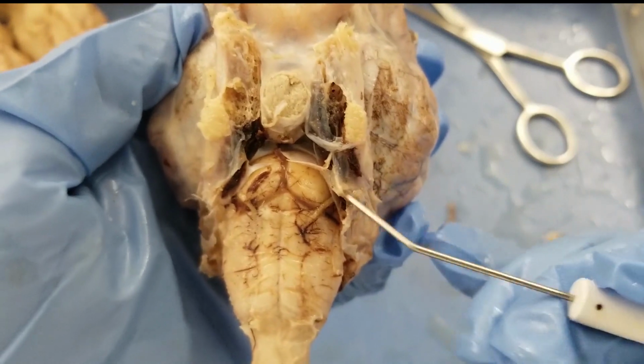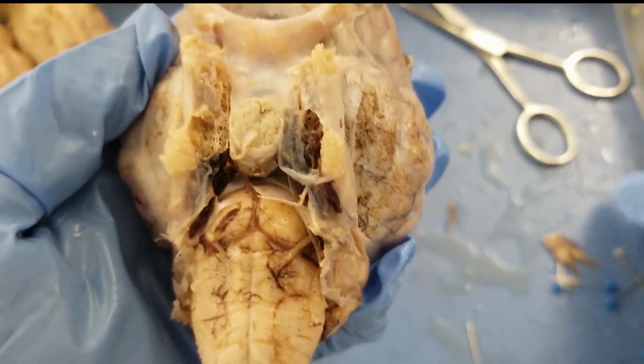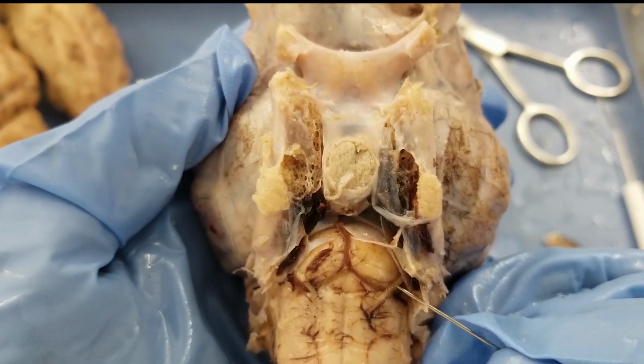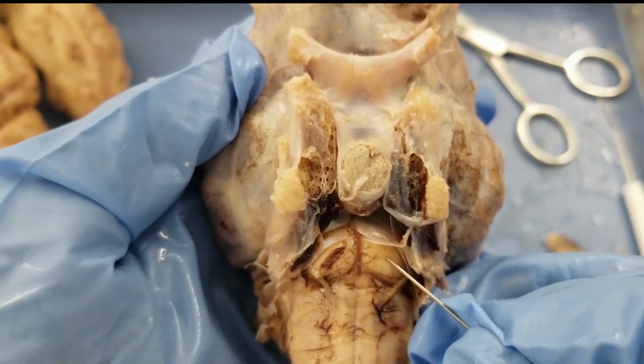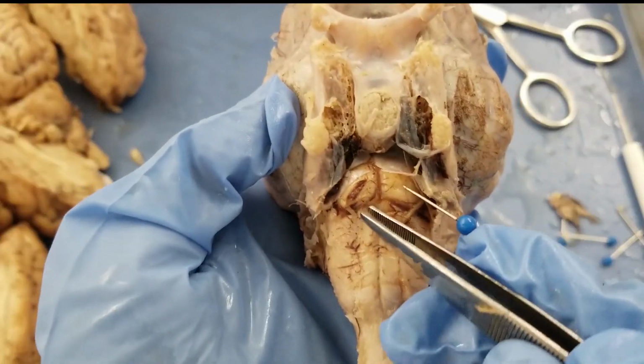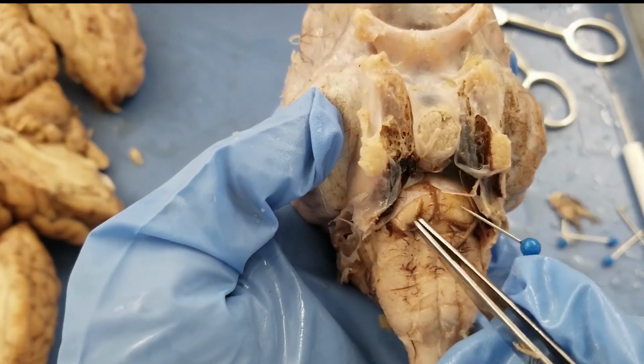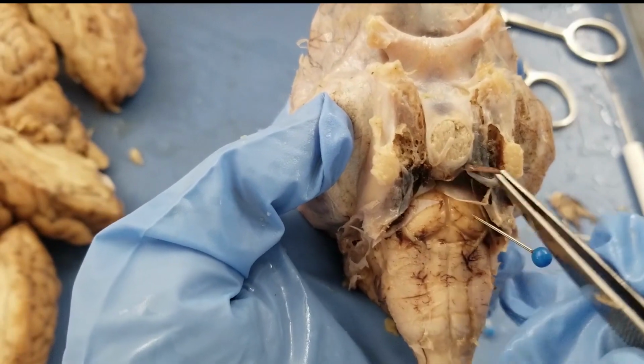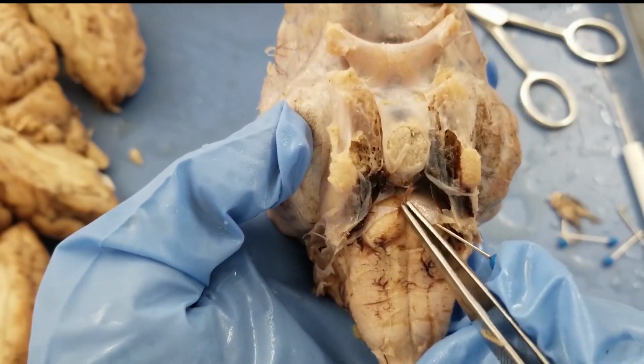Actually, you can see the pons better on the ventral view of the intact brain. So you see there is this round structure here and round structure here. These are the pons. And the brownish coloring here, that is a blood vessel. So I can remove that, and you see the pons a little bit better. So this is the pons.